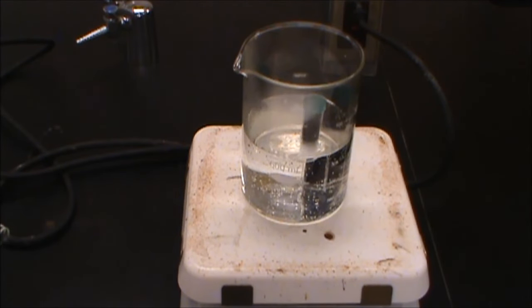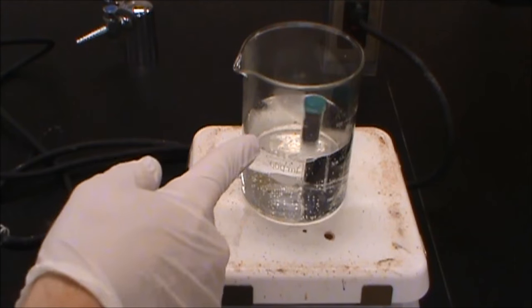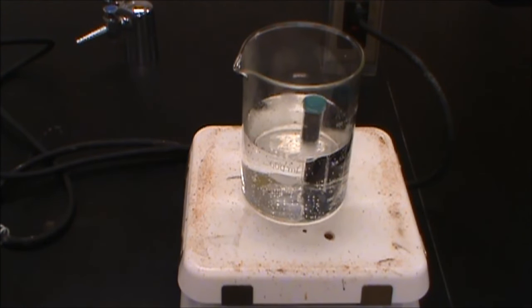So here we place this in our hot water bath. One of the things we want to watch for is we want to watch for bubbles coming out of that container. And other than that, we're just going to let this sit for 15 minutes and then we're going to go ahead and filter the reaction mixture.